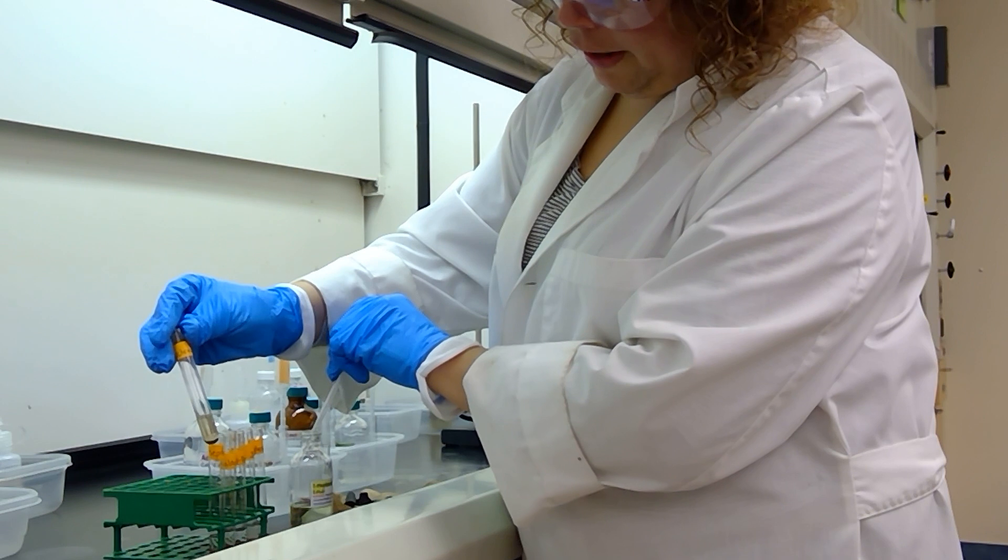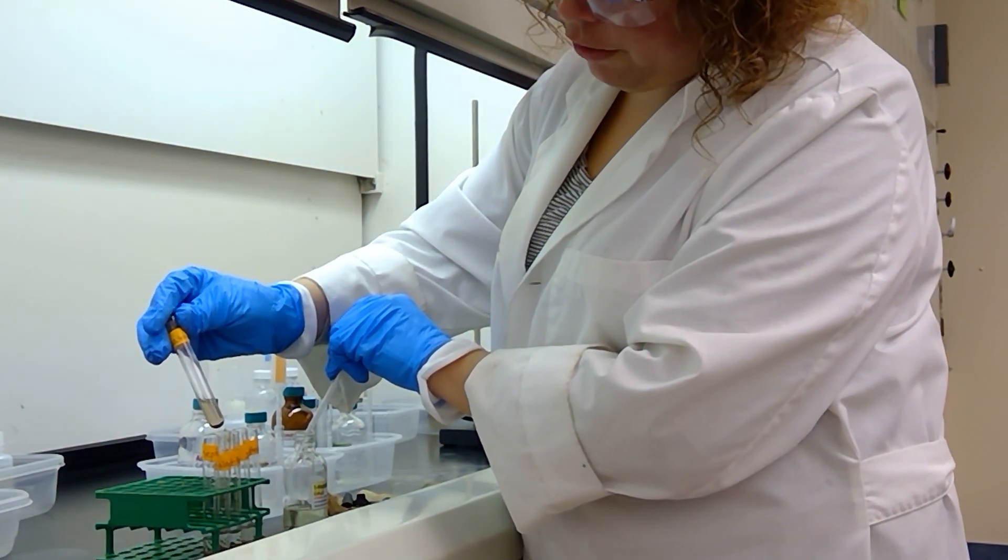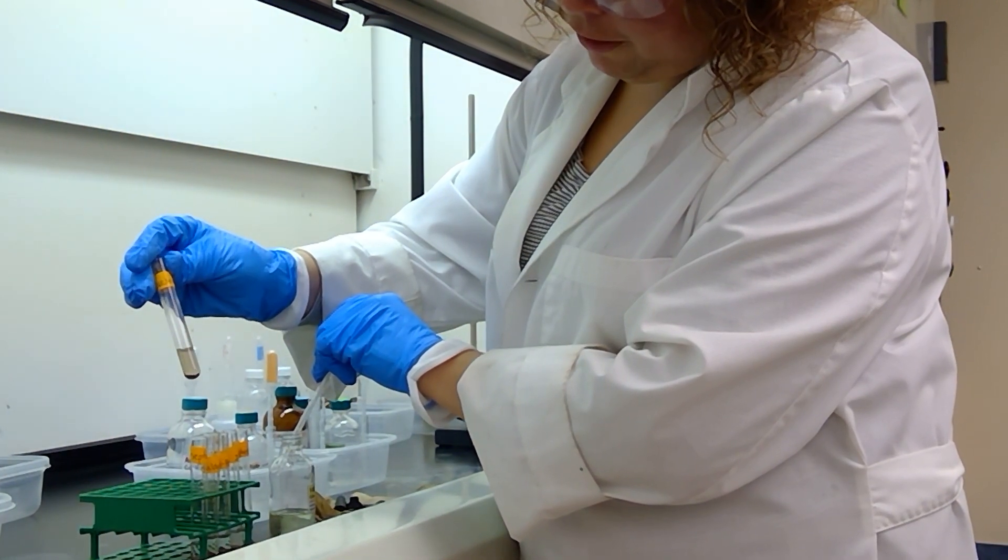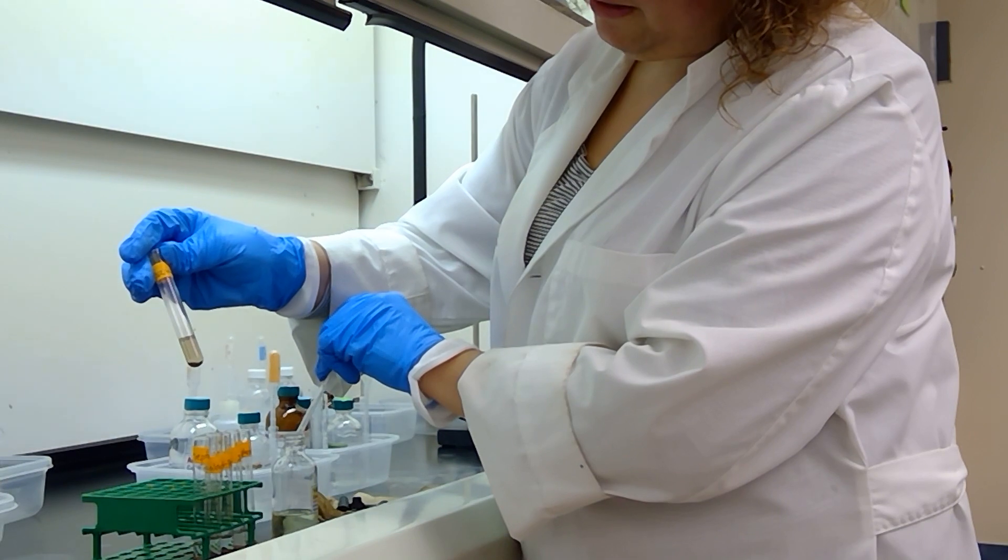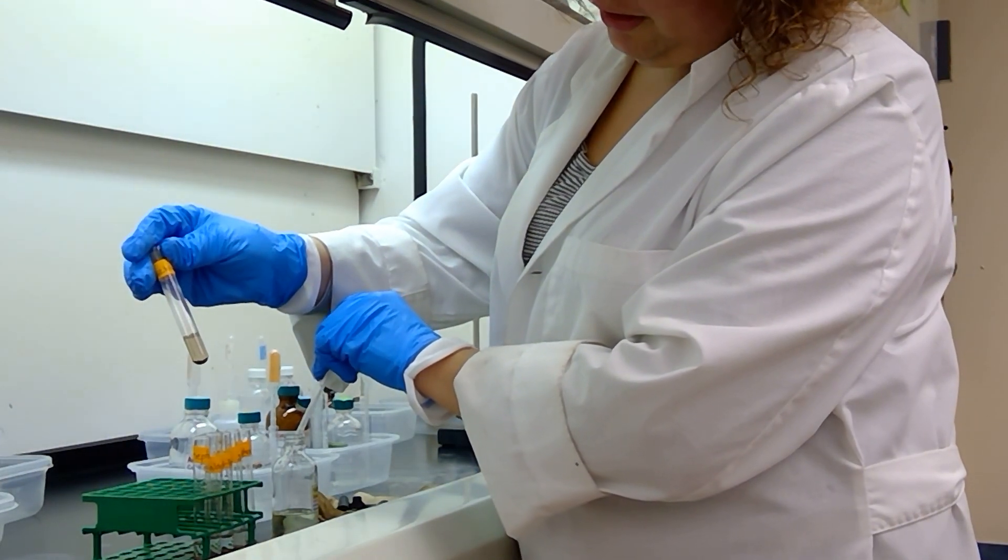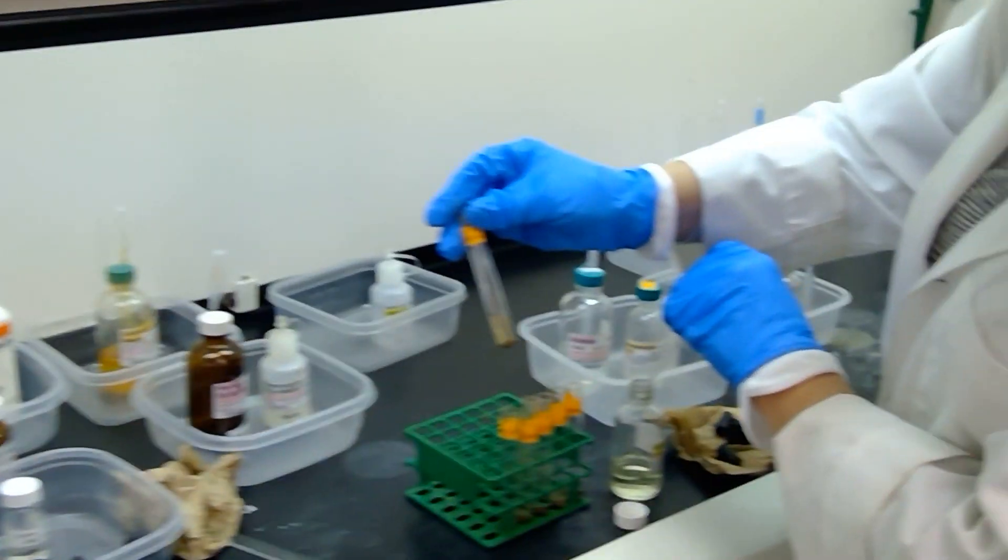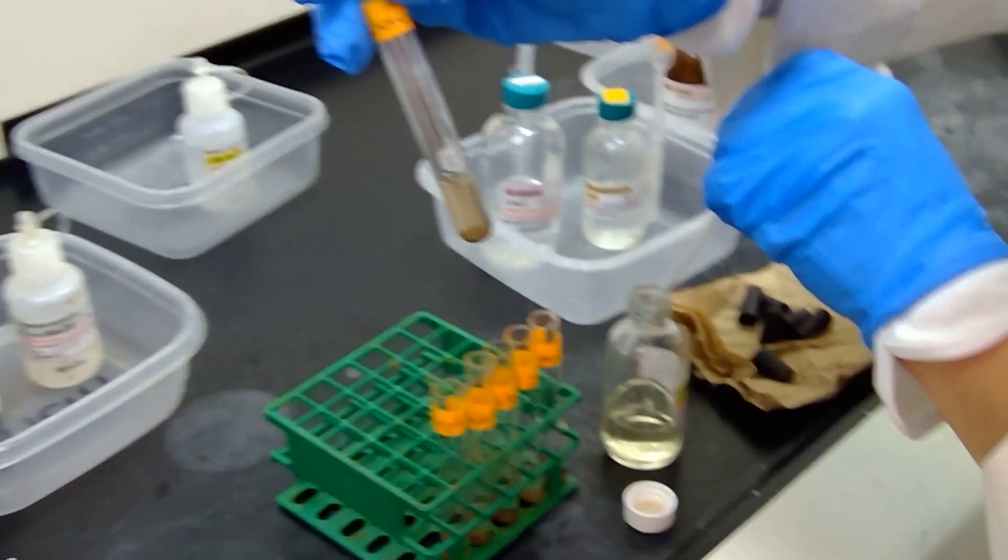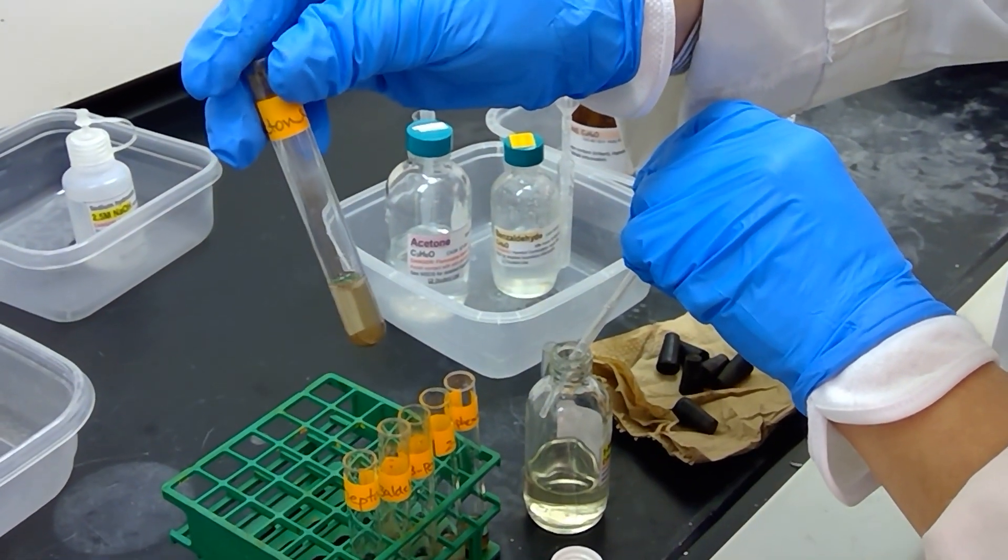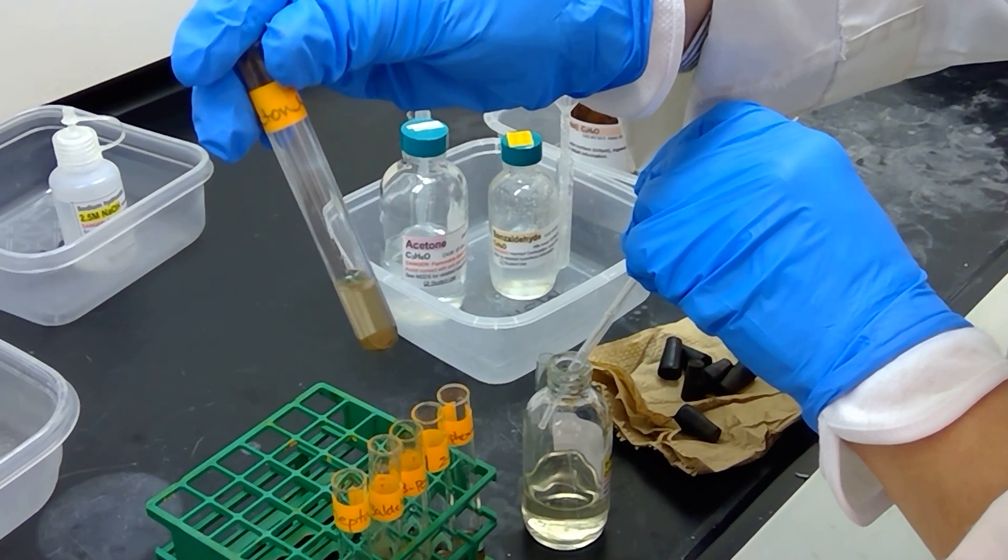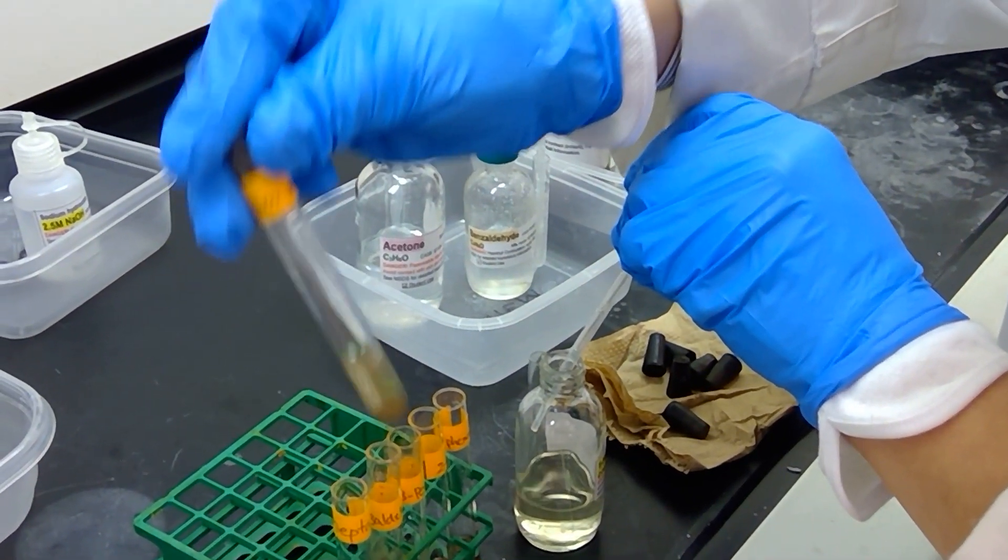So far we have added the silver nitrate, sodium hydroxide, and ammonium hydroxide. If you look closely here at my acetone sample, we have no reaction. That's what we are expecting because we have a ketone in acetone. Our solution is pretty much just a tannish gray solution with a little bit of solid at the bottom. You can see a little bit of a gas that is adhering towards the top of the test tube. That's a little bit of ammonia forming inside of the test tube.